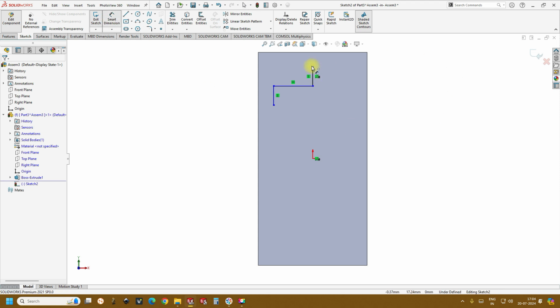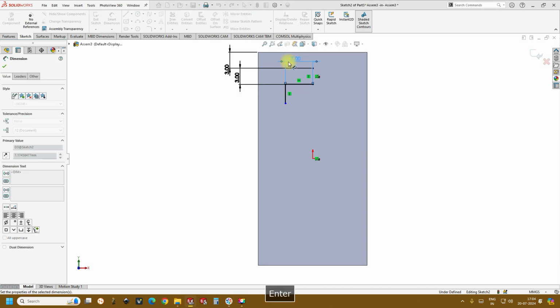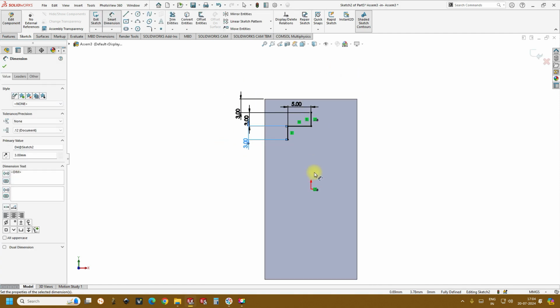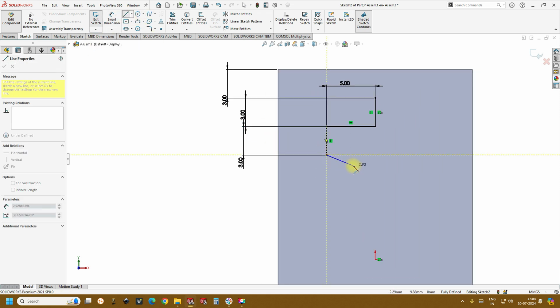So here let's give the smart dimensions. Initially this is 3 mm, and we'll keep this also 3 mm, followed by this as 5 mm, and this can be again 3 mm. Okay, and now the next thing is to create a zigzag. So we can just create a random shape initially.